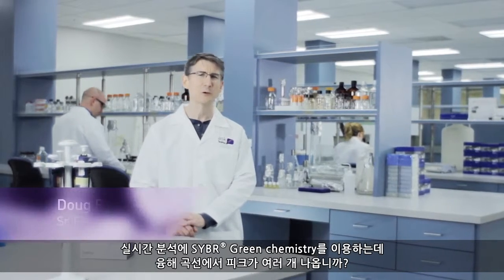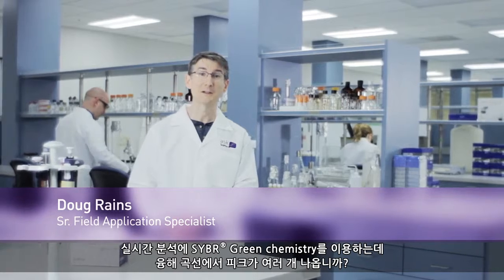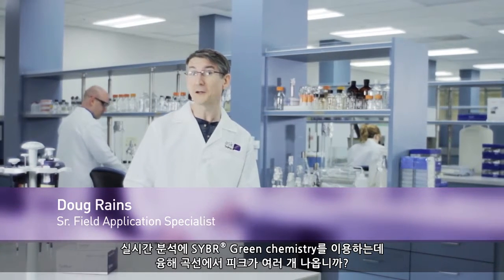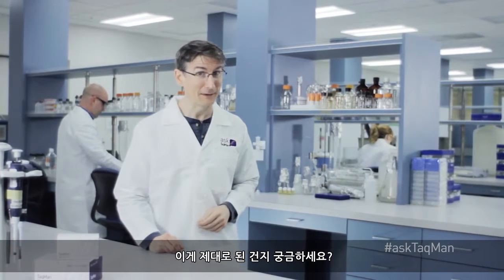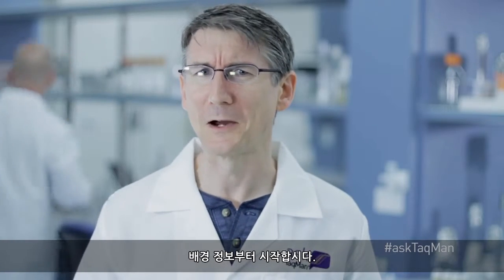Are you using SYBR Green chemistry for your real-time experiments and getting multiple peaks in your melt curve? And are you asking yourself, is this a bad thing? Let's start with a little background.